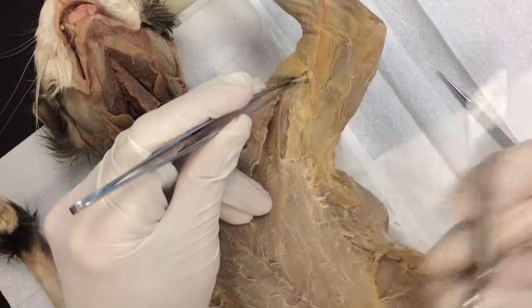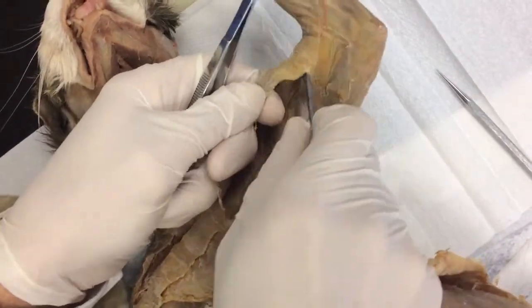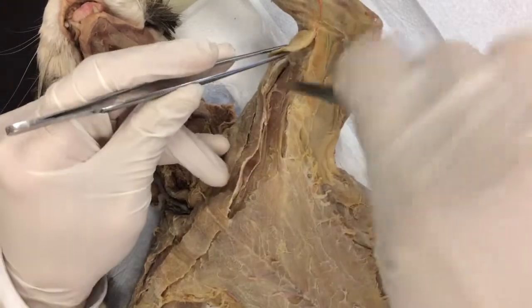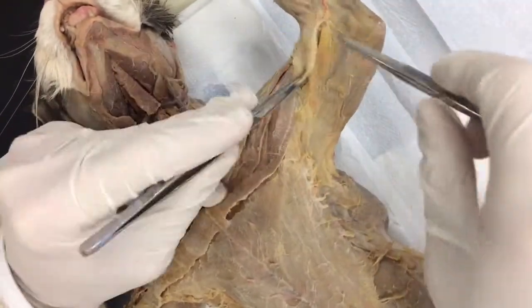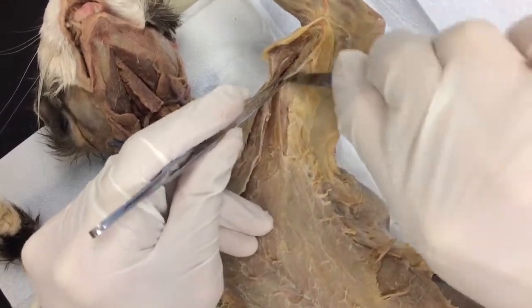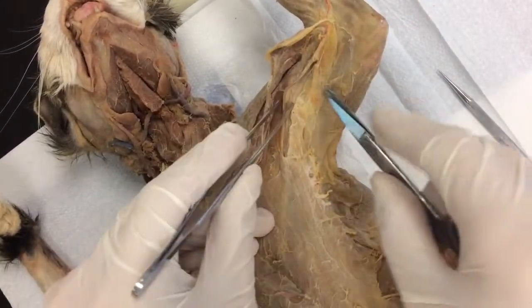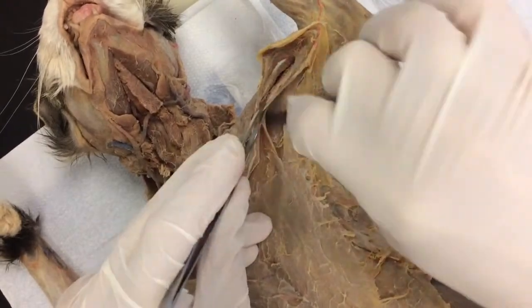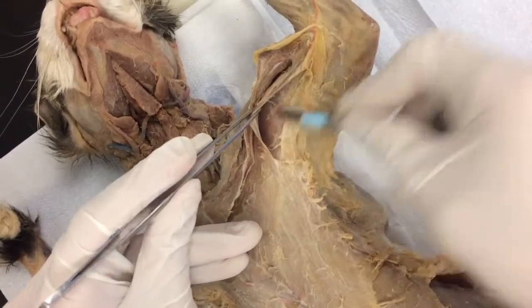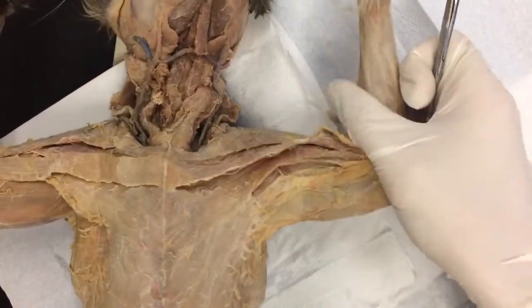Scissors — be careful. I'm going to flip it over. Make sure this one's all the way done; there's some connected tissue there. They've got to finish that upper margin, but make sure that one's all the way done. We're going to come right out to where the tendons are. You can see where it's starting to split into the upper and lower bundles. It's really easy right there, and you can see how much I already cleared out.